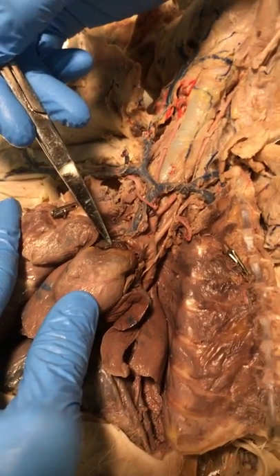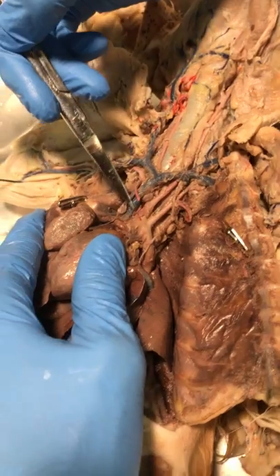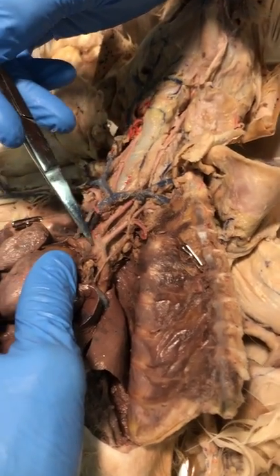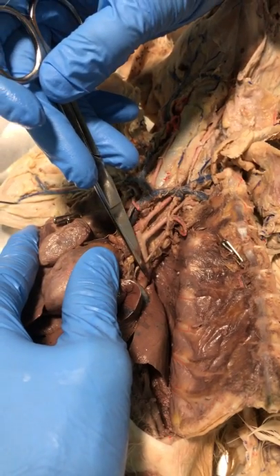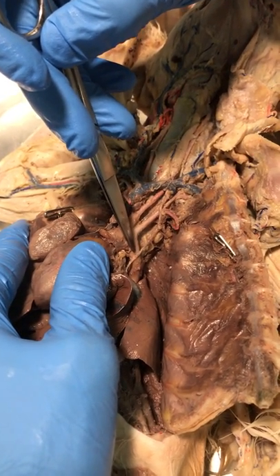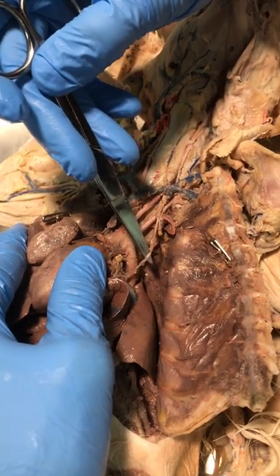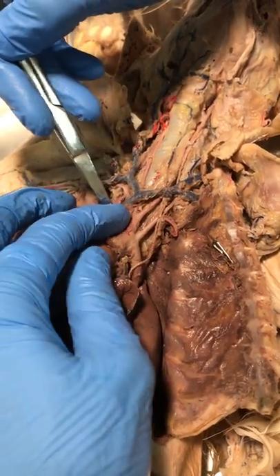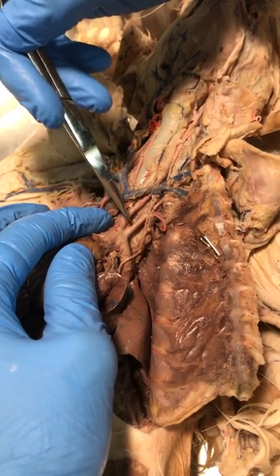Here's the right auricle. Let's look at the arch of the aorta. Here is the arch of the aorta. Notice that it continues down behind the heart on the left as the descending thoracic aorta. Here's the vagus nerve.